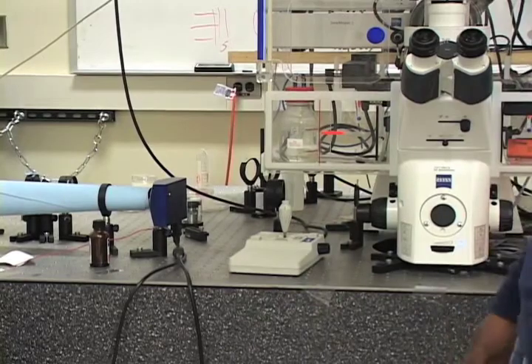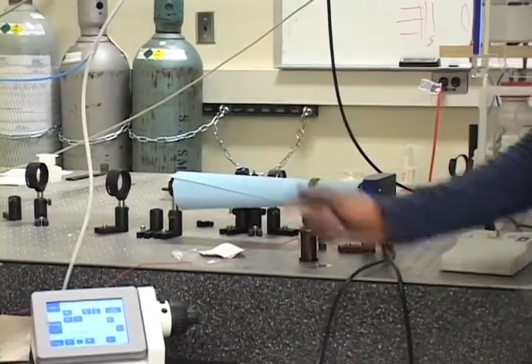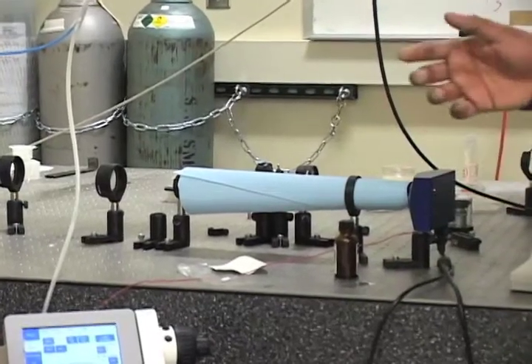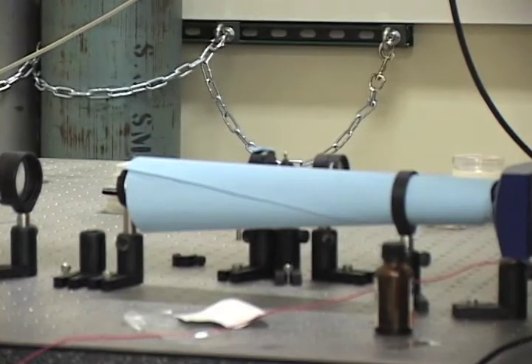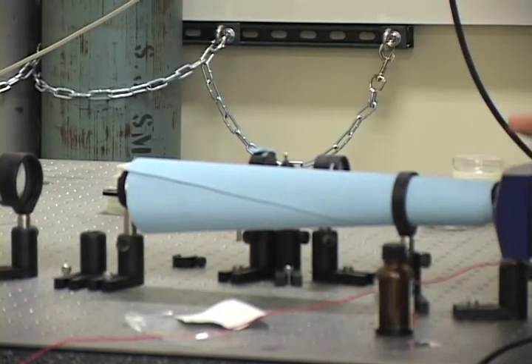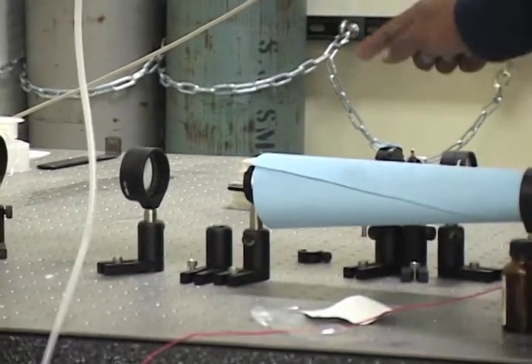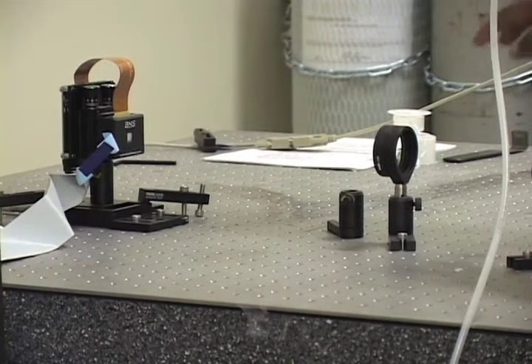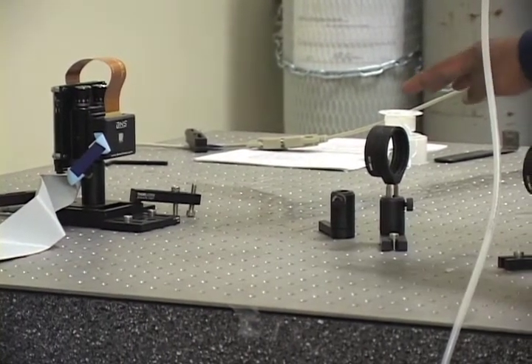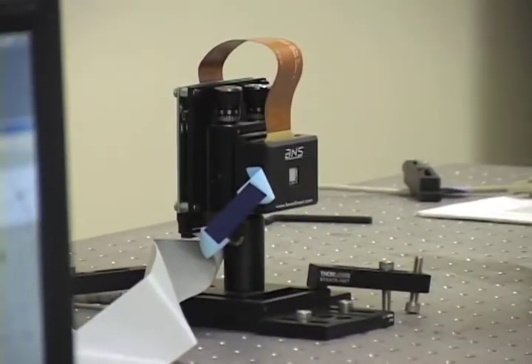so that we can properly fit it onto the aperture of our spatial light modulator. This component over here is a polarizer, and since we want to modulate only the phase of the field and not the amplitude, we have to polarize the light so that it's aligned with the fast axis of our liquid crystal modulator. After passing through this polarizer, this last lens is projecting the back focal plane of the objective onto that final component, which is the liquid crystal phase modulator.